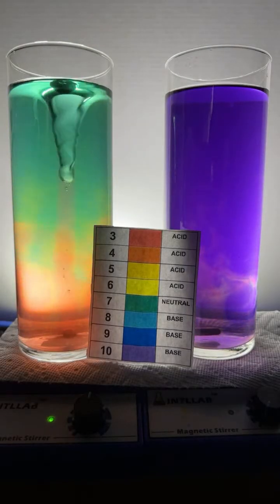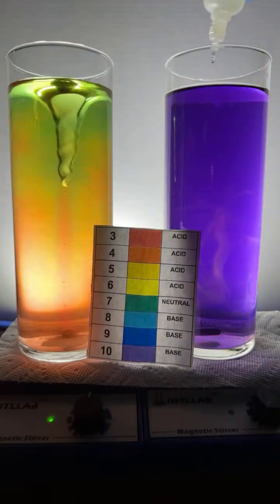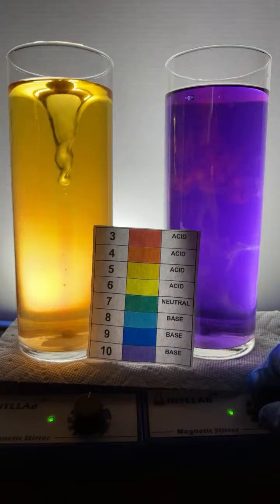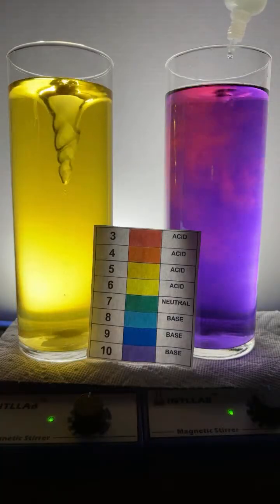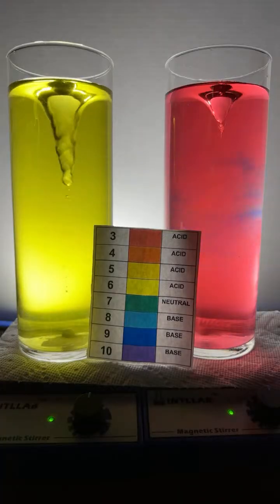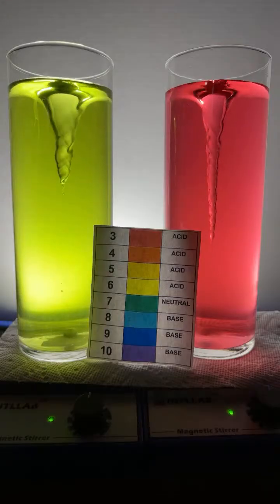Now, the acid that I'm adding, this stuff here, this is hydrochloric acid. Looks like I added too much base over here on the right-hand side. I'm going to add a little acid over here. The acid that I happen to be adding is 20% by weight hydrochloric acid. Now, hydrochloric acid is the same acid that's found in your stomach. It's just that your stomach acid is much more dilute than this stuff that I'm adding over here. The base that I'm adding is called sodium hydroxide. Some people call that lye.